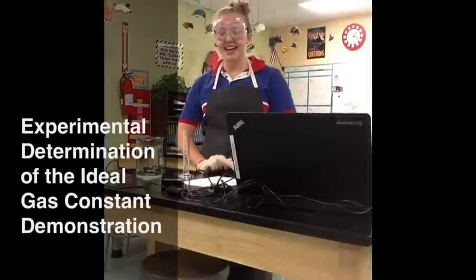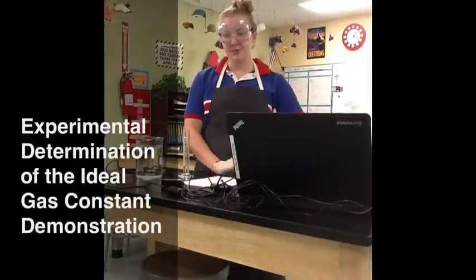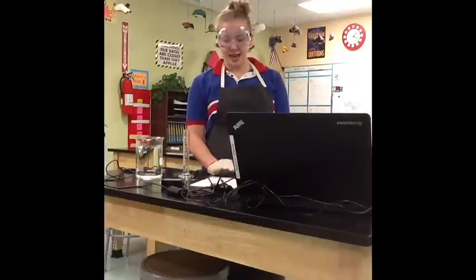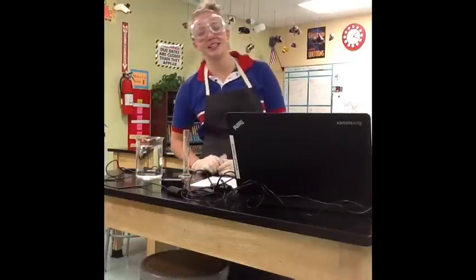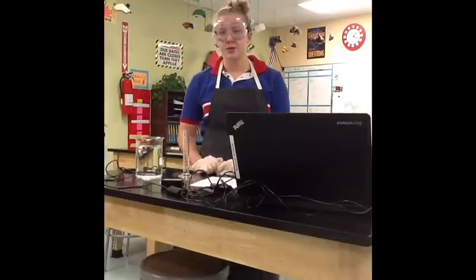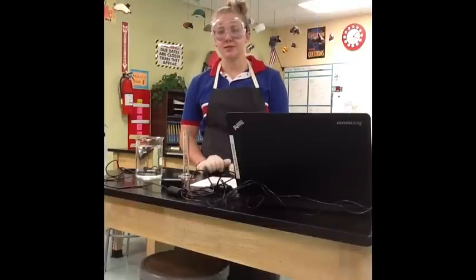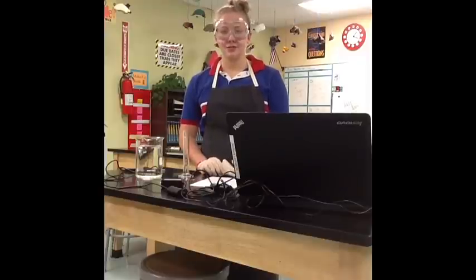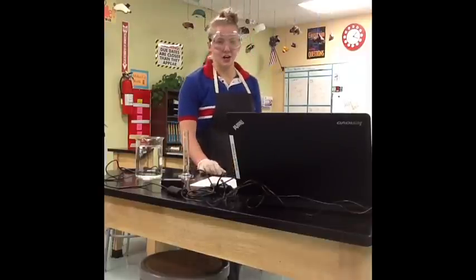Hi, my name is Tori Zala, and I'll be demonstrating the lab determination of a gas constant R. In this lab, we're going to be using the reaction between hydrochloric acid and magnesium metal to produce hydrogen gas. We'll be measuring the pressure, volume, temperature, as well as the moles of hydrogen gas, and using our PV equals NRT equation to find our gas constant R.